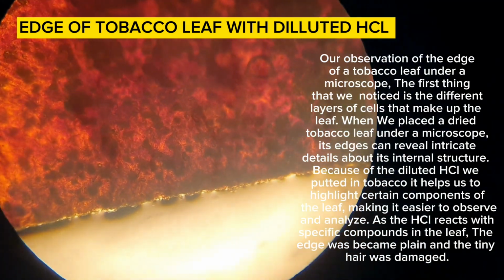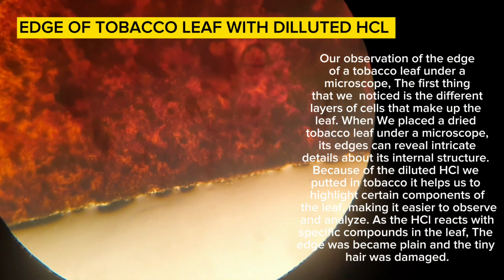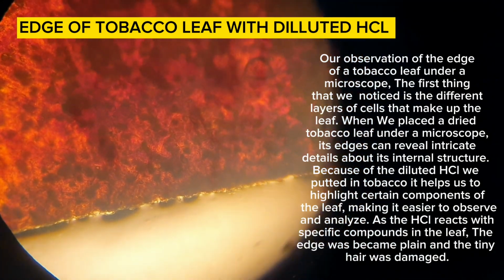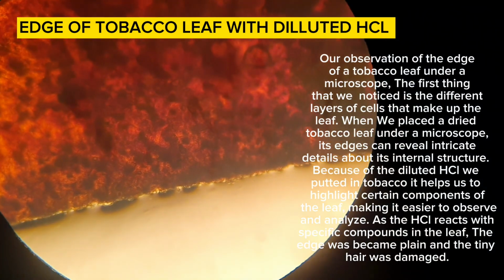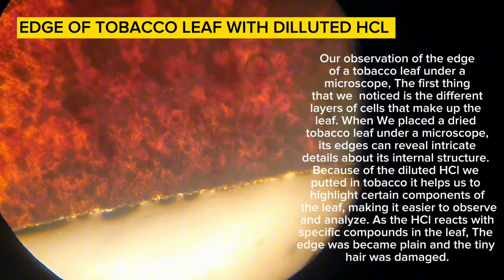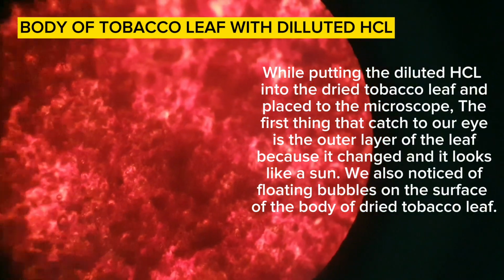When we place a dried tobacco leaf under a microscope, its edges can reveal intricate details about its internal structure. The diluted HCl helps us highlight certain components of the leaf, making it easier to observe and analyze. As the HCl reacts with specific compounds in the leaf, the edge became plain and the tiny hair was damaged.